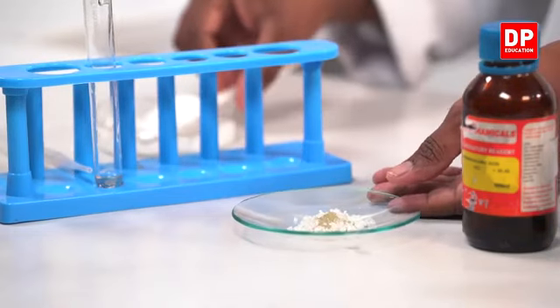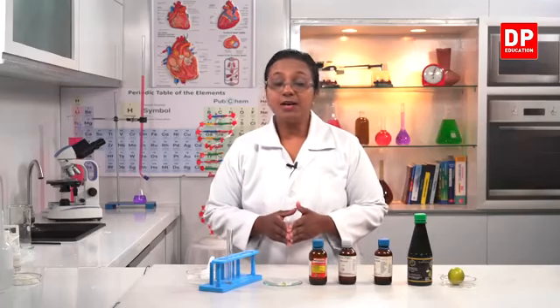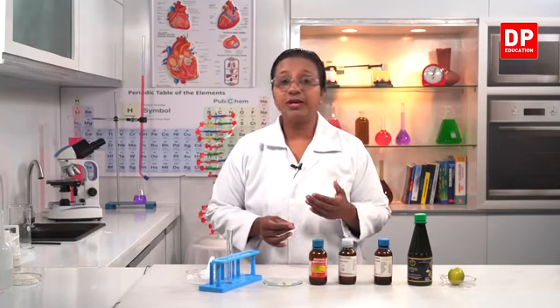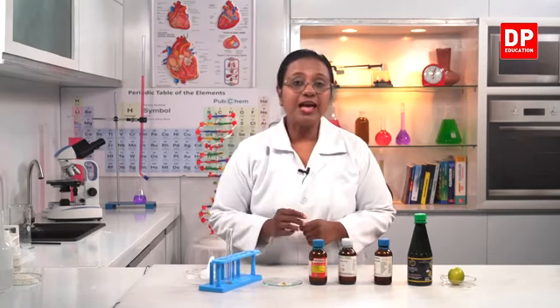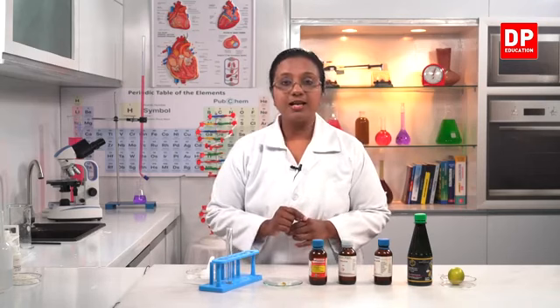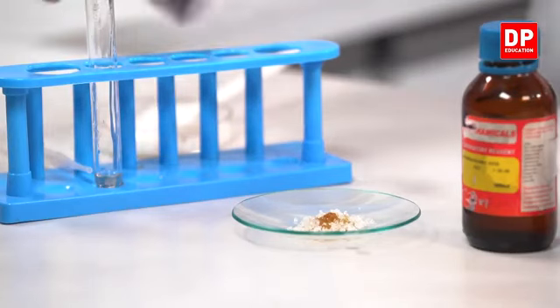Observe what happens. Now here you know sugar is a crystalline structure, and what is the chemical formula of sugar? It is sucrose. So it's C12H22O11. So there are water molecules. So when we add concentrated sulfuric acid, observe the changes. It has become light brown in color now. You can see gradually the color becoming darker.